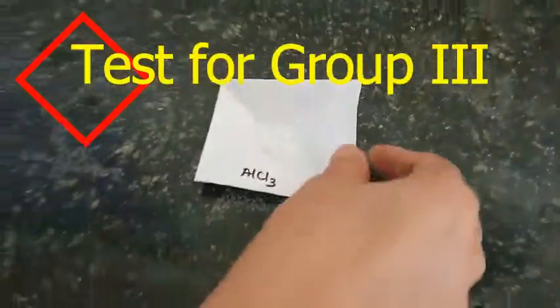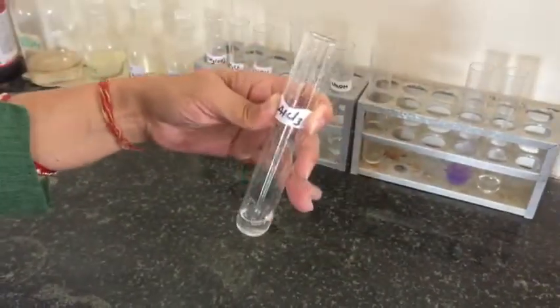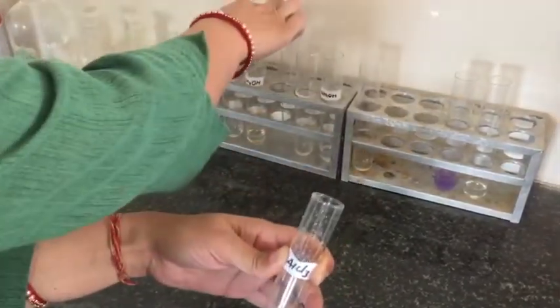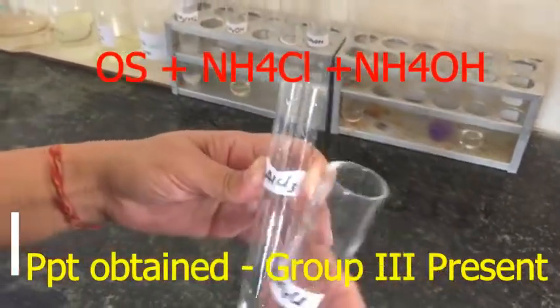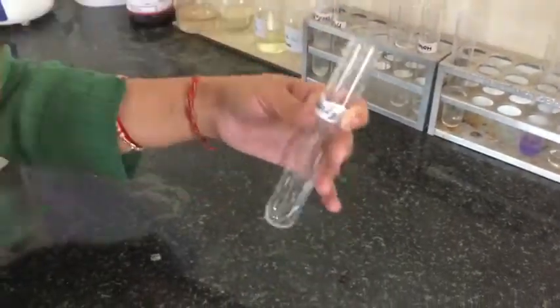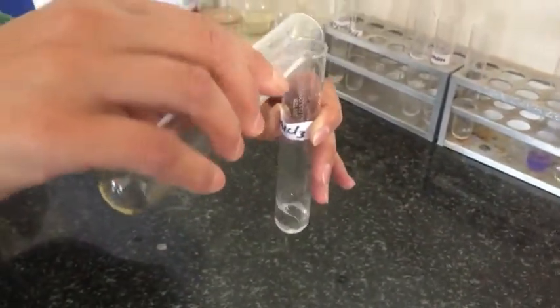Now, test for aluminium. It is of the third group, and for this third group, the group reagent is ammonium hydroxide in the presence of ammonium chloride. To this original solution, I am adding ammonium chloride and then ammonium hydroxide. If we get a white precipitate, it confirms that the third group is present.